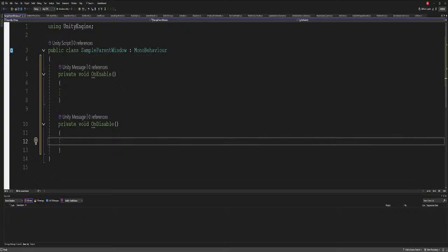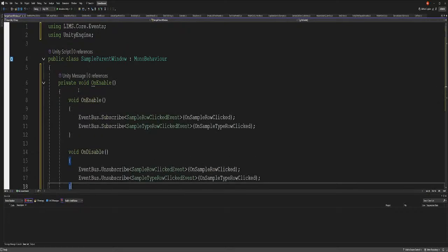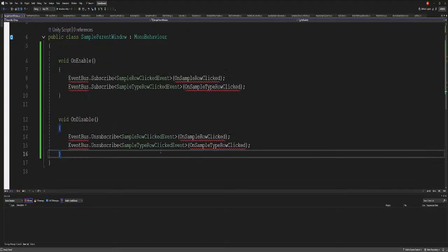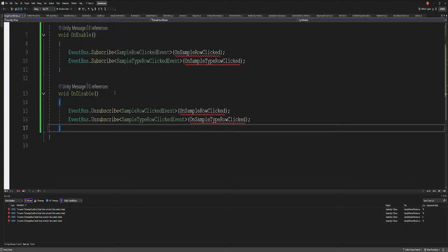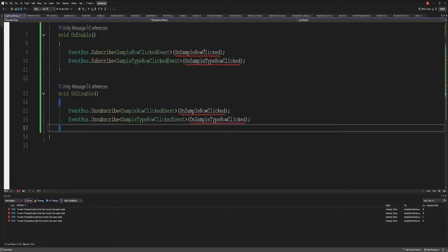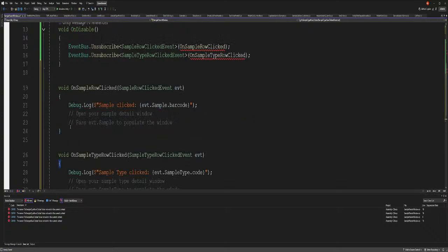All right, let's start. So I wrote down my notes. Event bus, you have to use the username, I believe that's it. On the sample parent, yeah, that's correct. So now we have to make these methods. I'm going to cheat and just copy and paste from my notes, so we don't take so long.